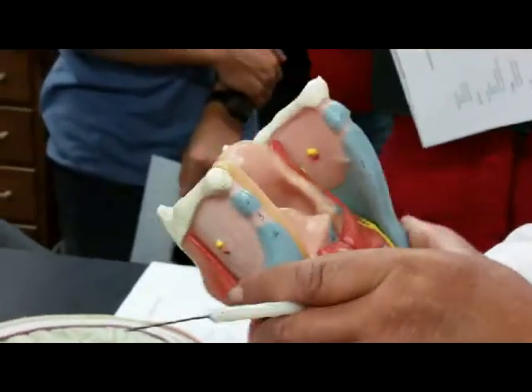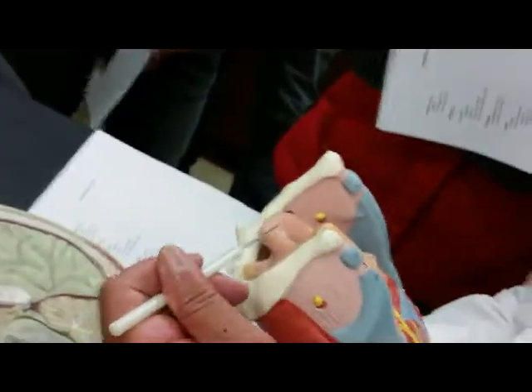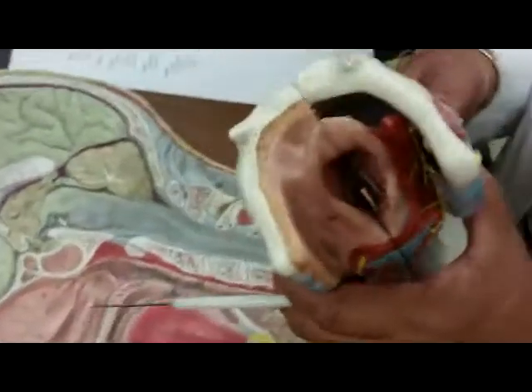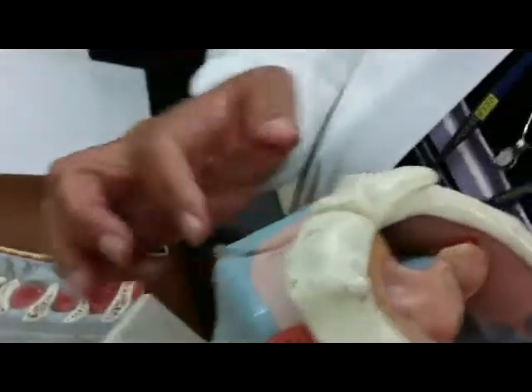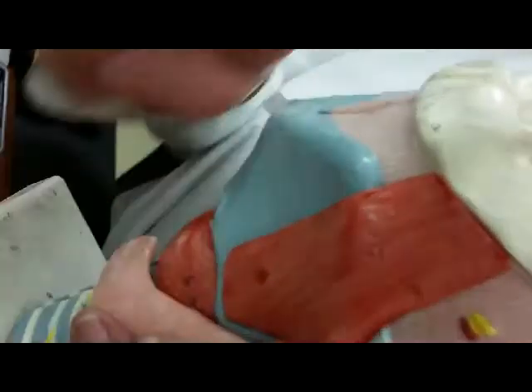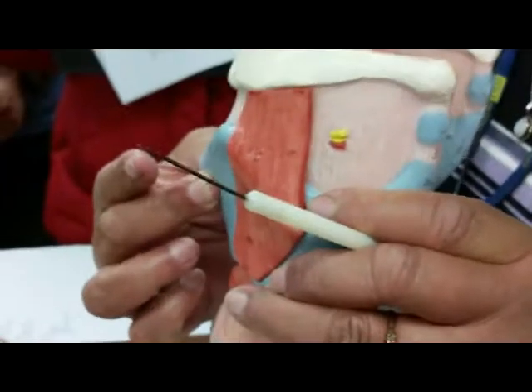So they ask us to point out parts of the larynx. This is the epiglottis. The hole is the glottis. And part of the larynx, the blue, represents the thyroid cartilage. This is the part that in men becomes pronounced as the Adam's apple. There are other cartilages in the back that we're not responsible for. Just responsible for this one in front, which is the thyroid cartilage.